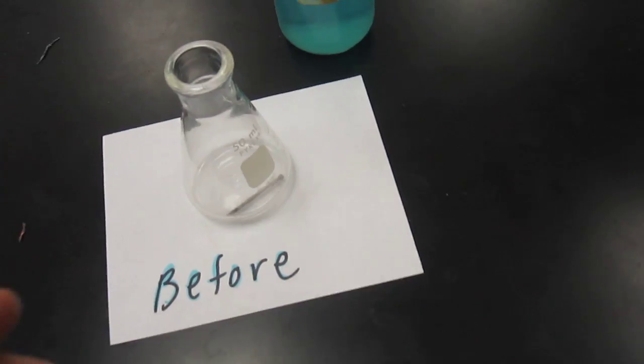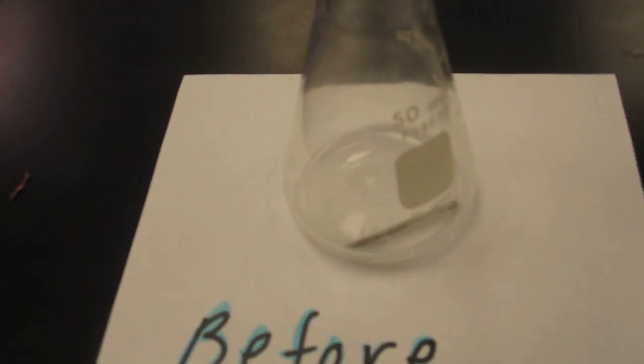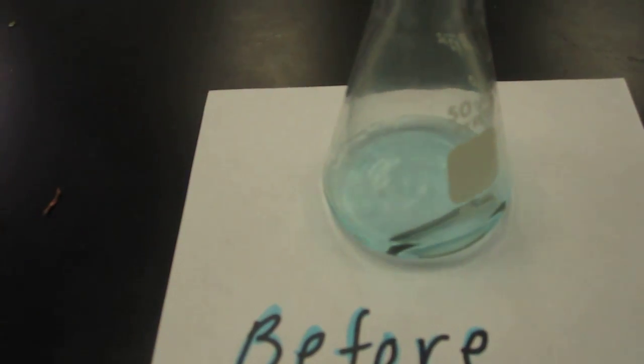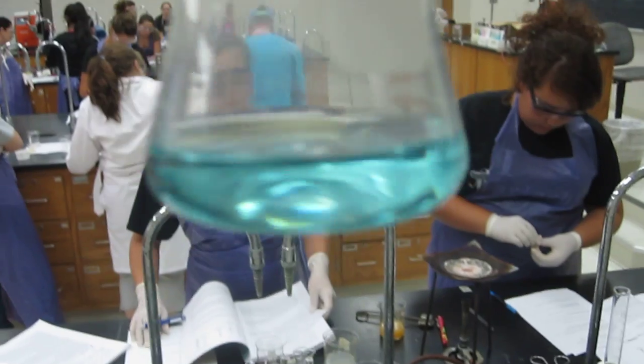Before, this is what it looks like. You just have a nail and a blue solution.